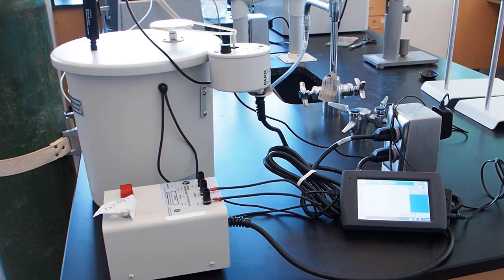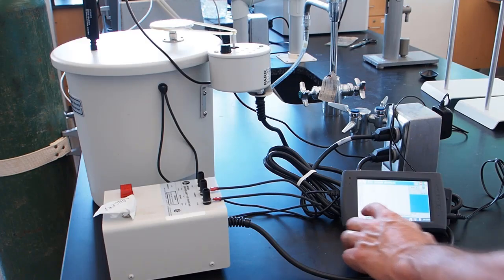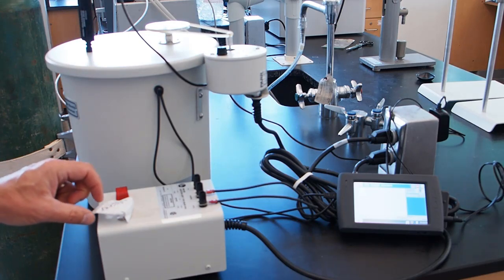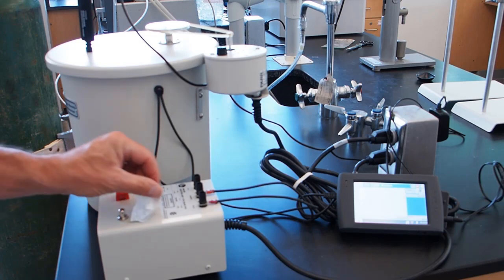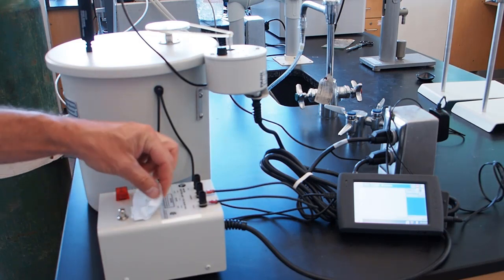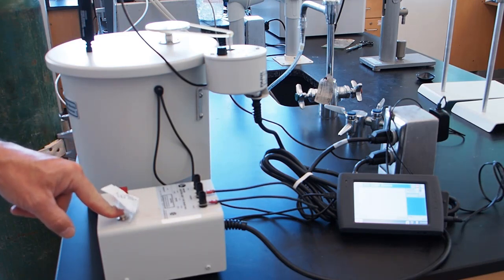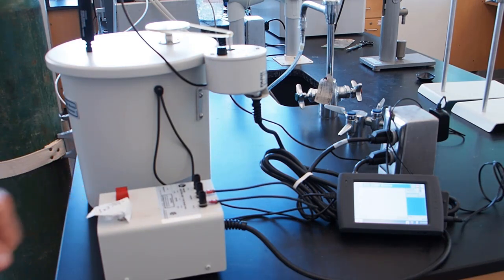Okay, so we're going to start recording, but not do our ignition yet. Okay, so it seems like the temperature is quite stable at 22.7, 22.8. We're now going to go ahead and ignite our reaction using the danger button. I'm going to push this now. And the light flashed, which meant the reaction happened.